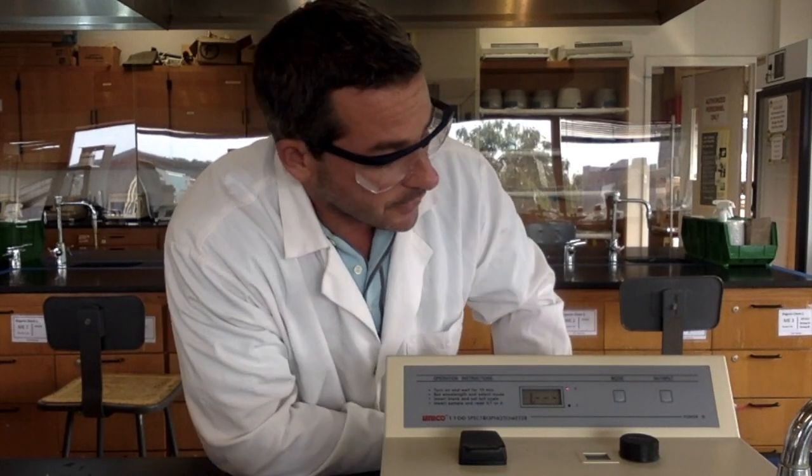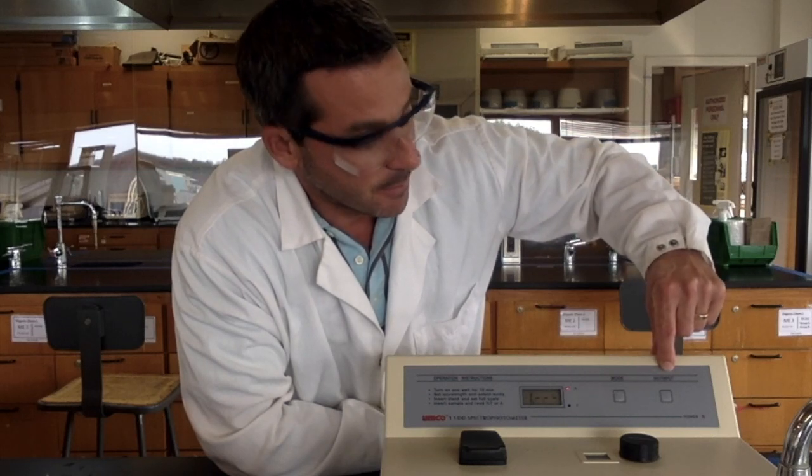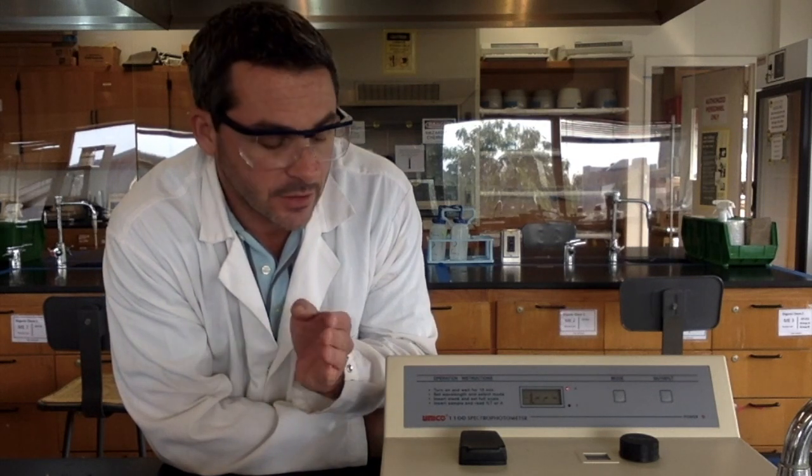All right. Also over here we have what is called the zero absorbance 100% T button. Another thing we need to do is tell the spectrophotometer what a sample that absorbs no light looks like. For that, we're going to use distilled water. Distilled water is clear, so it's not going to absorb any of these wavelengths of light. So we set the machine to 0 on that, and then we measure the absorbances of our sample.